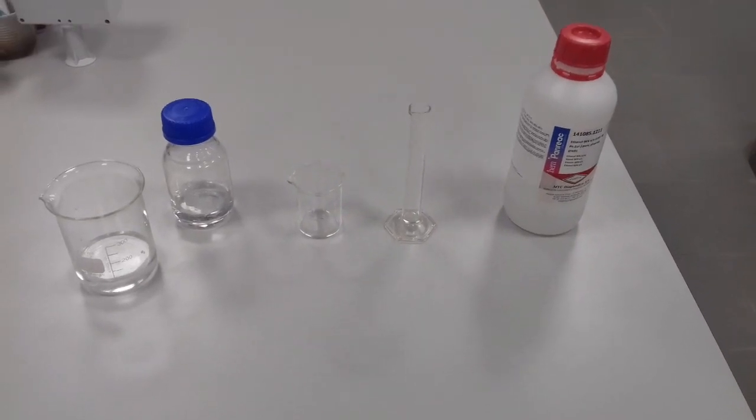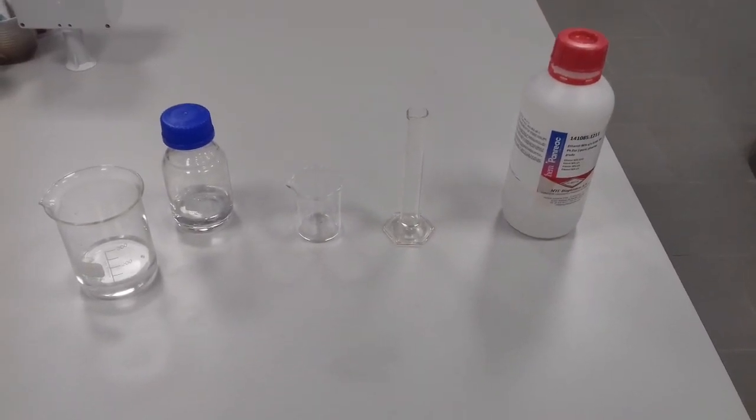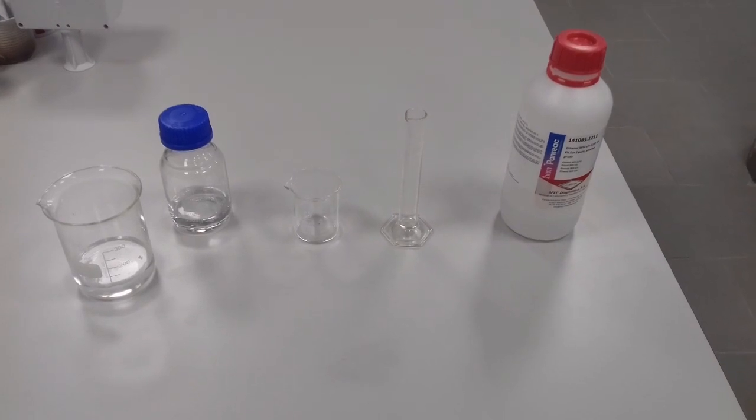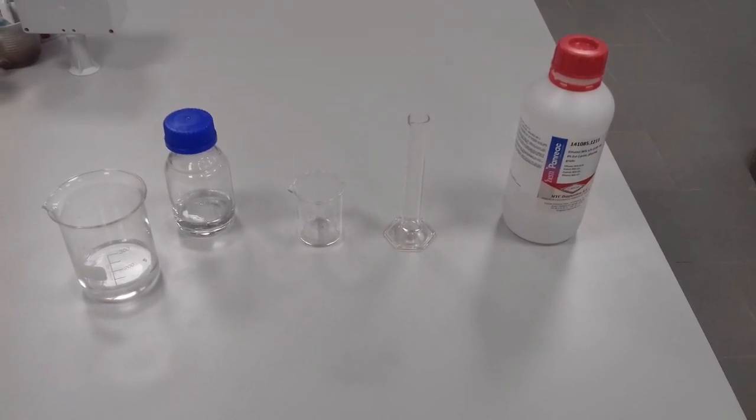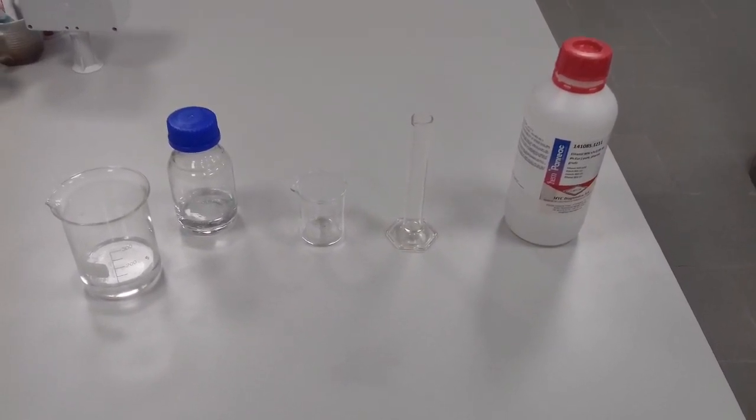Hello everyone, today I am going to show you how to prepare a 70% ethanol alcohol solution. It's very fast and it's very simple.